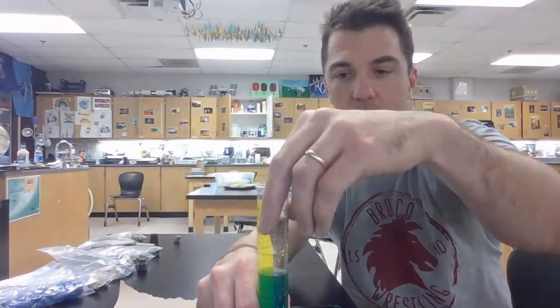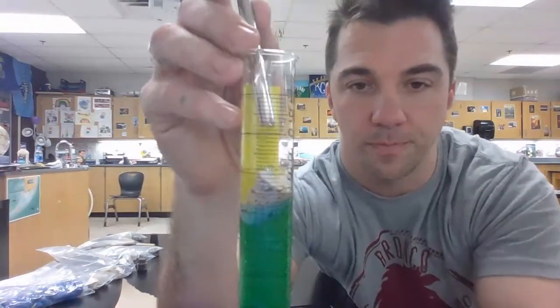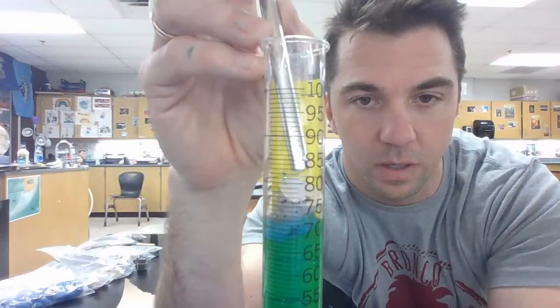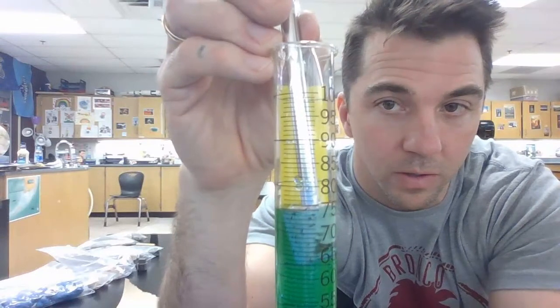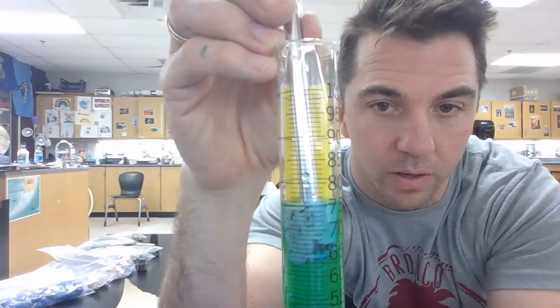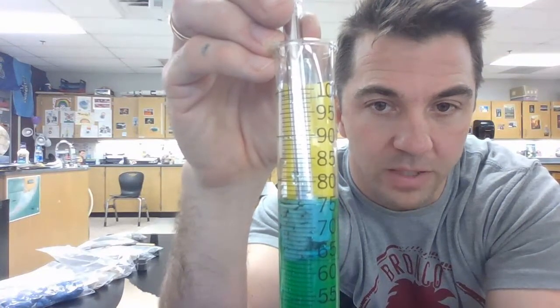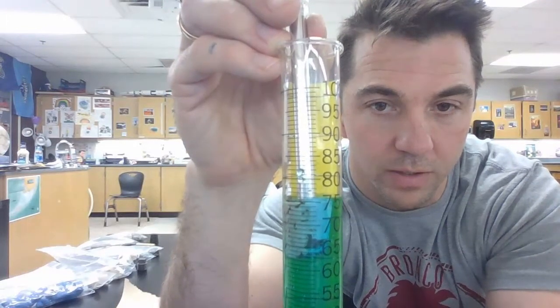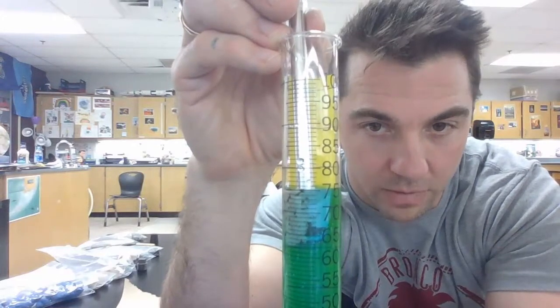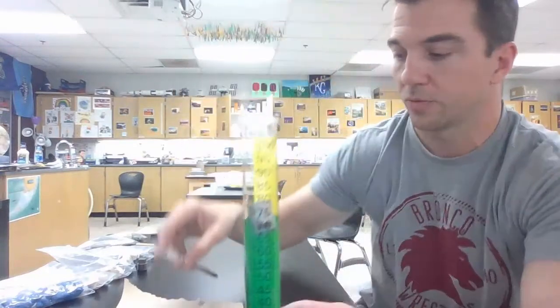I'm going to put the cork in. Like I said, it doesn't fully go down. So let me get a good view here. I'm going to push it down further, maybe. I can. Right about there. I know it's maybe not the best view, but again, I've started at 70, and you should be able to kind of tell where the water level is. Do your best, spot it out, and record that number. That was for the cork.